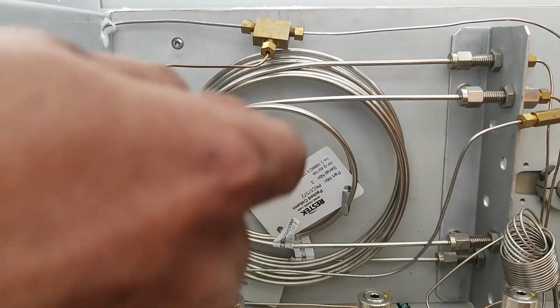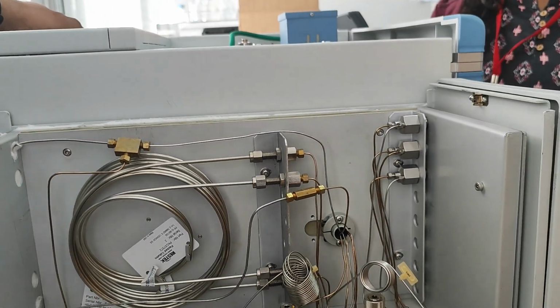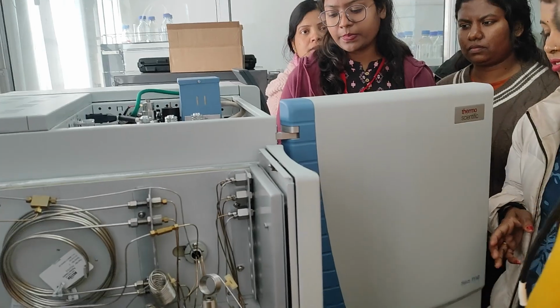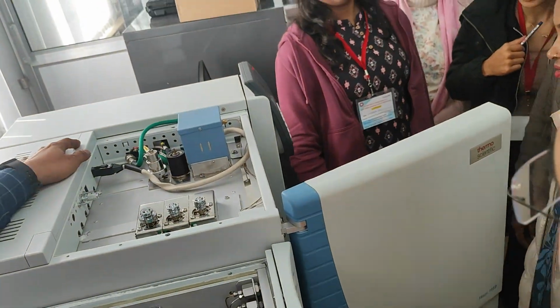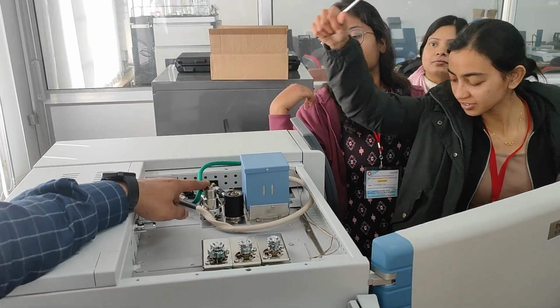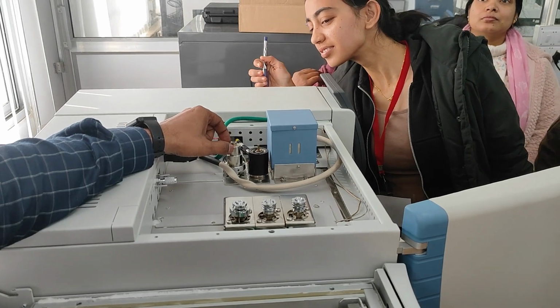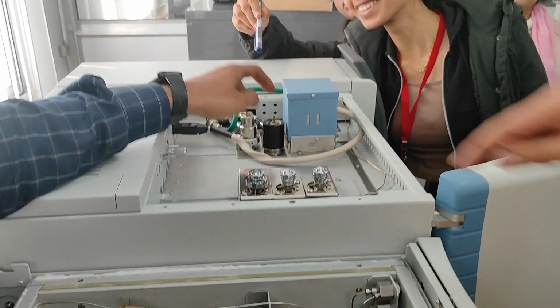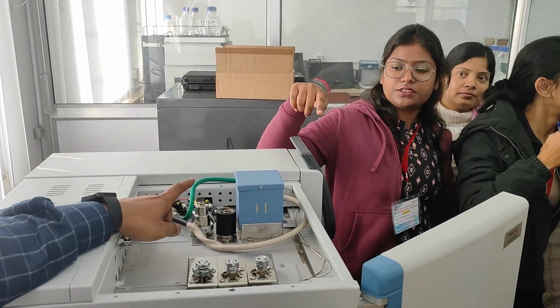Don't look over here. Yes. Show me. Open the door. Ma'am, show me the ECD, electron capture detector. Which one? This one? This one is the ECD? Confused. This one is the FID, flame ionization detector. There is a flame inside, right?